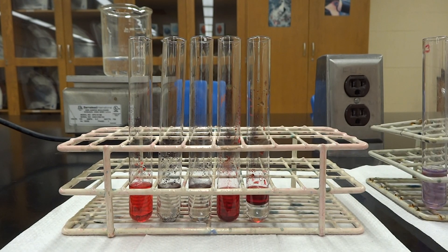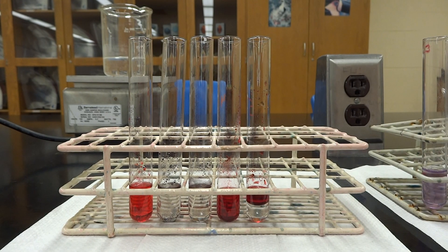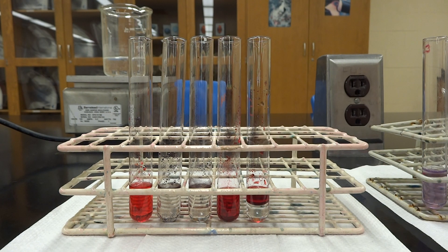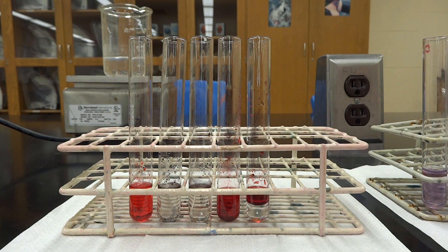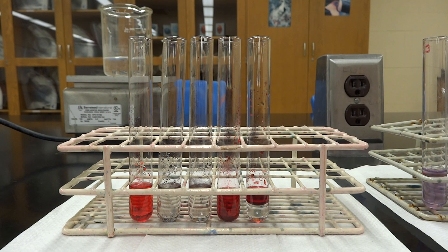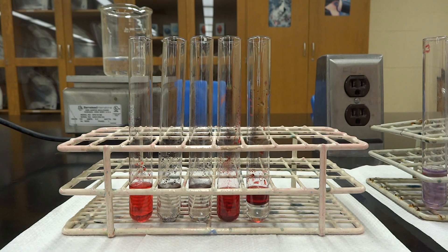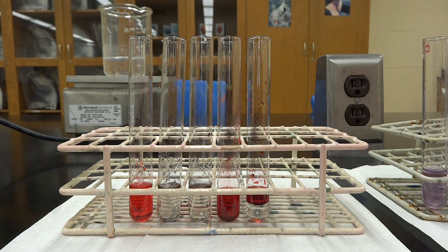We're moving into procedure 4.3 of the Biological Molecules Lab, looking at what happens when we test for lipids. For this, you're going to use what we call the Sudan IV powder, and it is kind of messy. It is a non-polar substance, which means it's going to dissolve very well into our fatty substances.